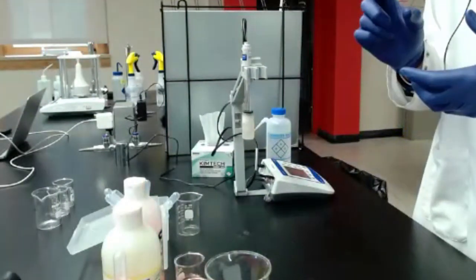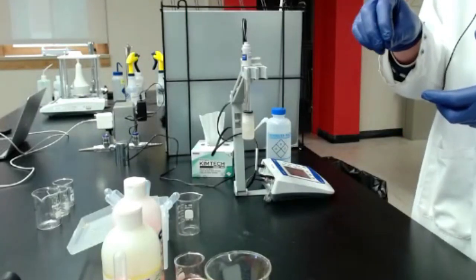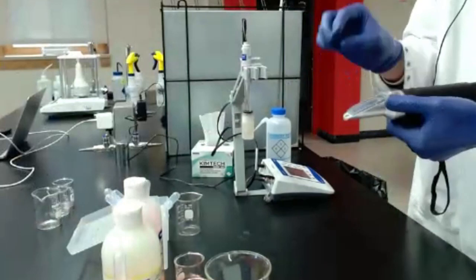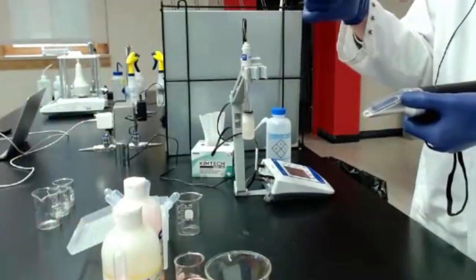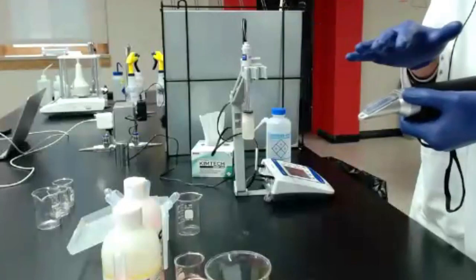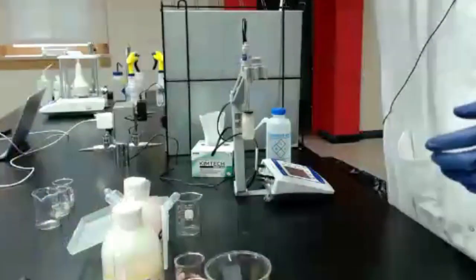And you can do that, as I mentioned with the manual refractometer, you kind of just drip on a couple drops right from the grape. Just make sure you're getting consistent values across once you move to the next block or row or whatever. However you're going to harvest and group your vines, you're looking for a consistency across that. So any questions about the sampling portion?